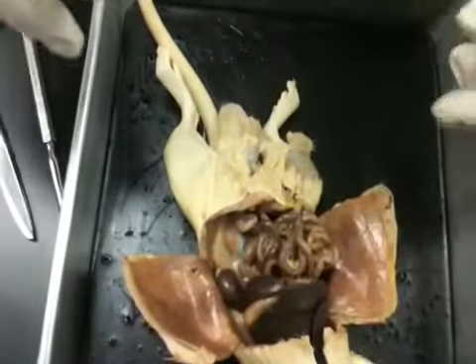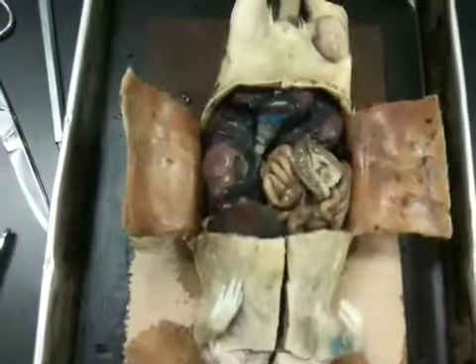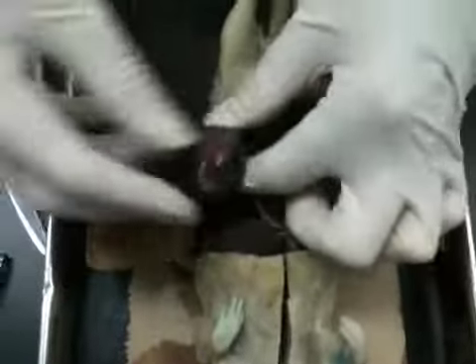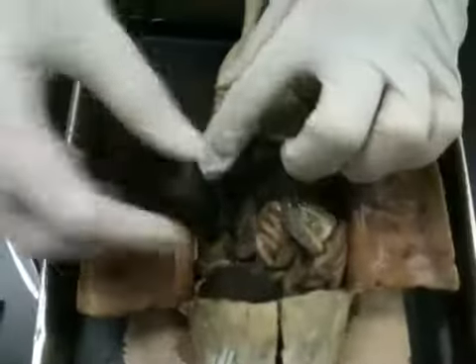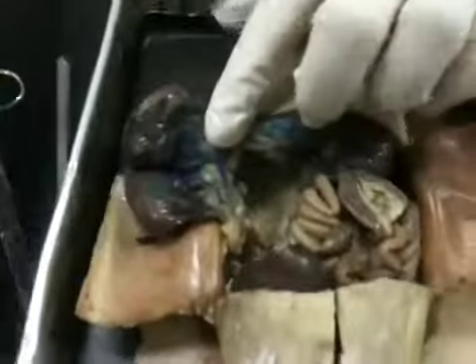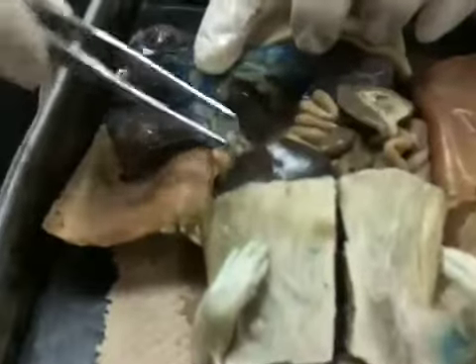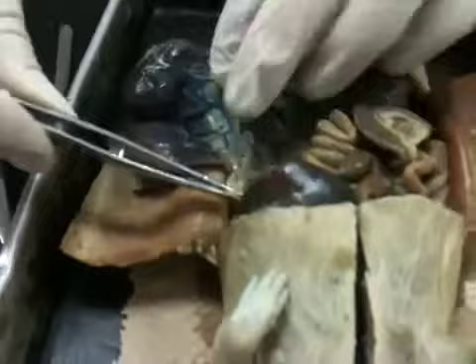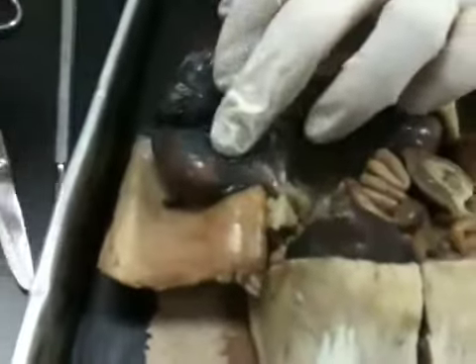So let's go over the pregnant female. And let's try to find some of the same things for her. So obviously, here's the babies right here. We need to follow this all the way up. This cream white colored material is fat. She's obviously going to have quite a bit because she's pregnant.